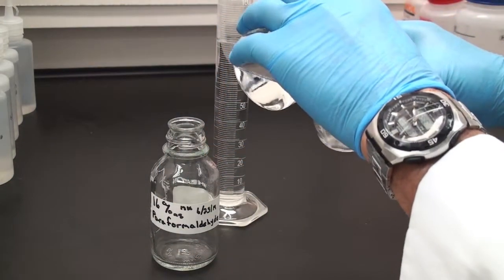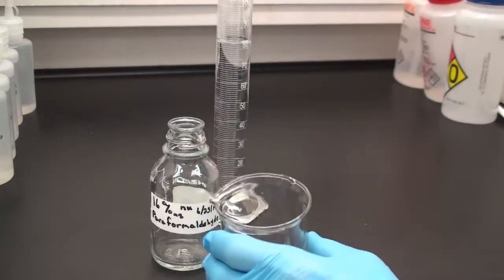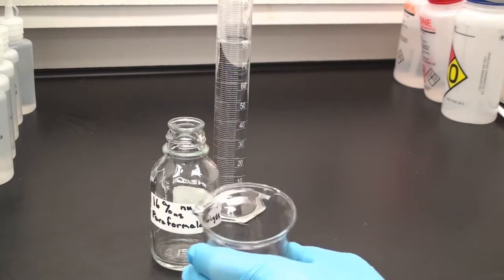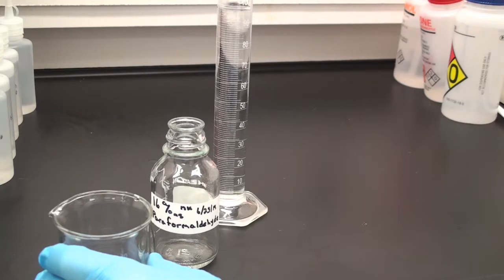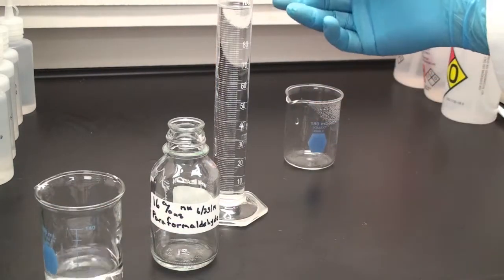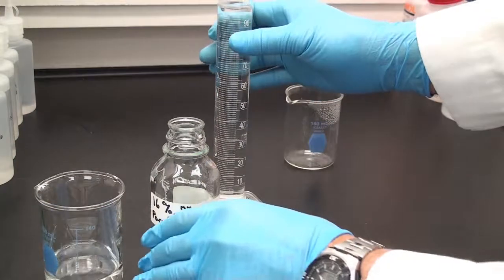So I'm going to pour a little bit of water in here to rinse out the paraformaldehyde, and I make sure that I don't put in too much. And as I load that up, wouldn't you know it, every once in a while you get a little bit lucky. I pour the exact amount in there and my beaker is empty.